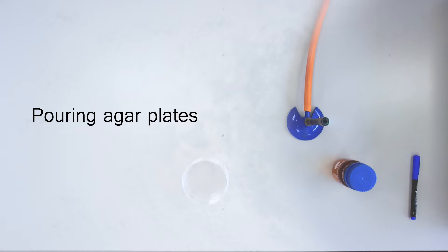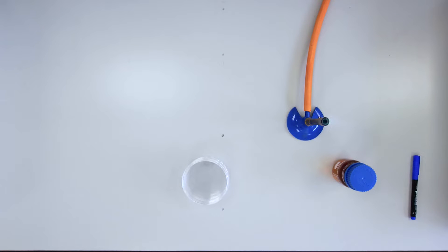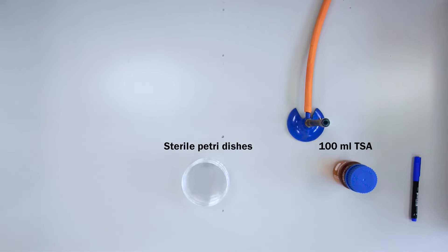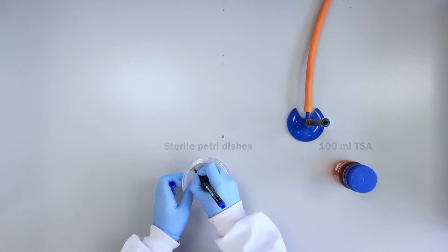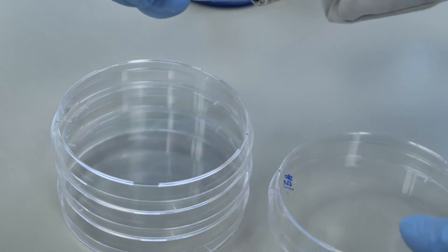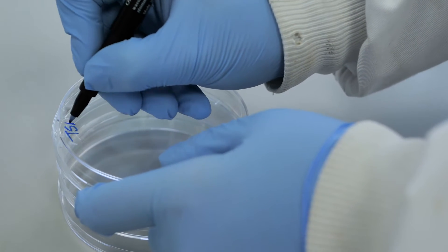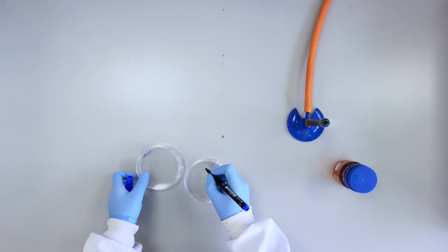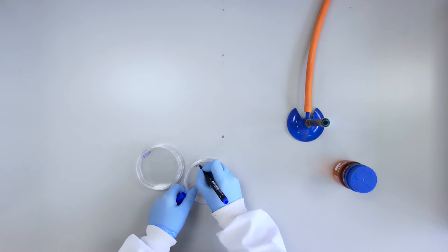How to pour plates. Sterile plates and a 100 milliliter bottle of sterile TSA agar are provided. The plates are left stacked.